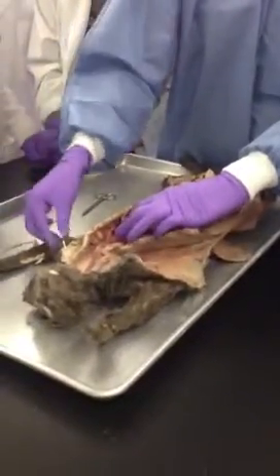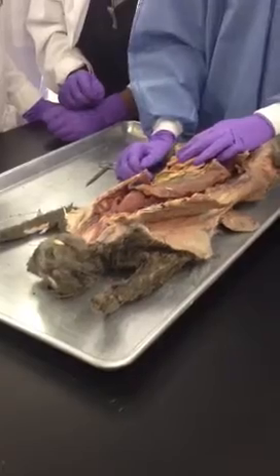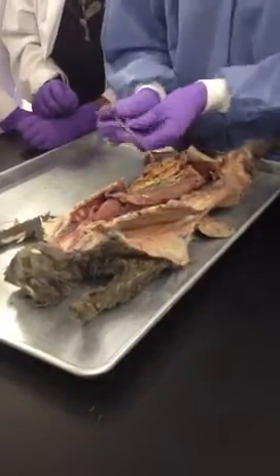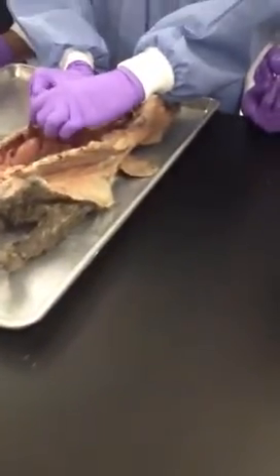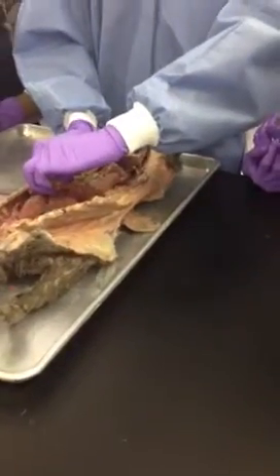Diaphragm. What cavity am I in now? Well, I'm really more in abdomen than abdominal pelvic, but yes. All right. Do you see this ligament right here? Yeah, I see that ligament right there. All right. The ligament.